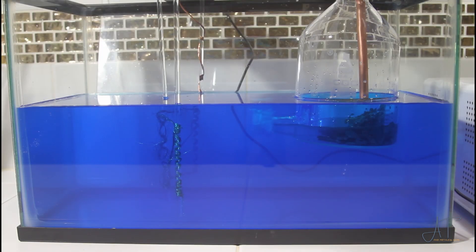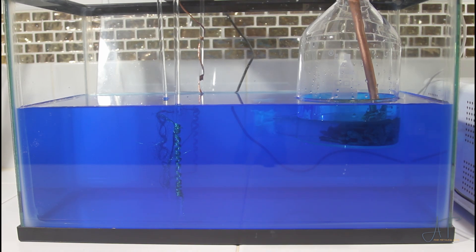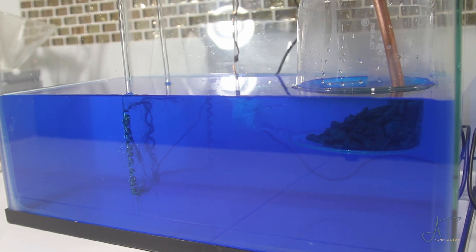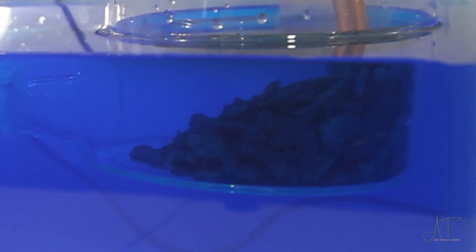Just like we're using in our other copper cells, we'll use just a piece of copper pipe as our anode. Keep in mind that any part of the anode that is submerged in the copper sulfate solution will start to corrode away, so it's better to pile up your shot kind of out of the solution a little bit and then have the copper anode rest on top of your pile of shot, which I do add more as we go forward. I'm a little concerned about the smaller neck on this aspirator bottle — it's a 19/26 outlet. I couldn't find anything larger online like my other anode bottle that is a 24/40 on the bottom, which has worked pretty good, but this is a much narrower outlet compared to that other one, so we'll see how it does.